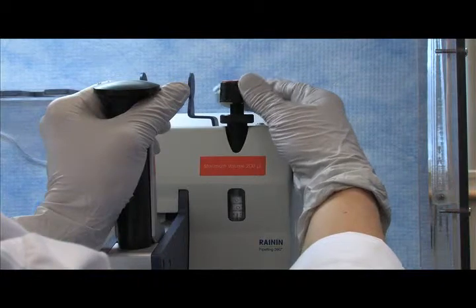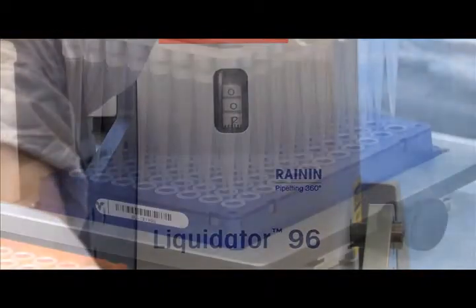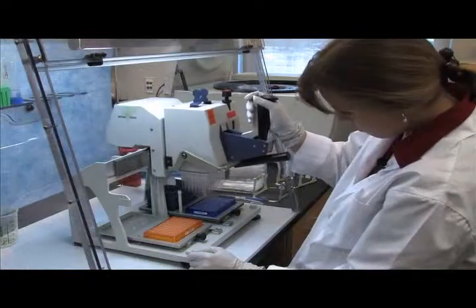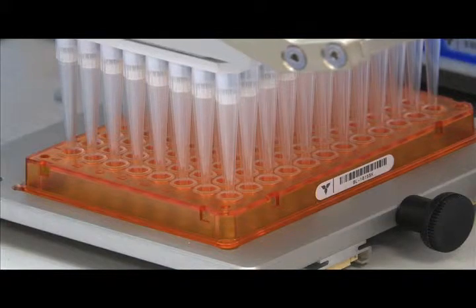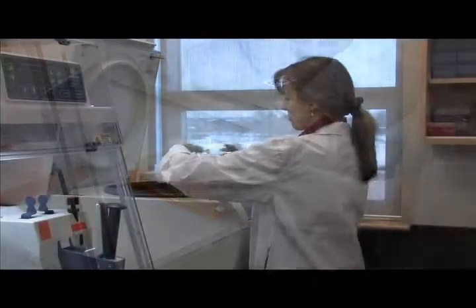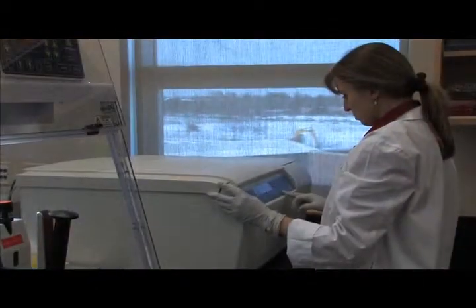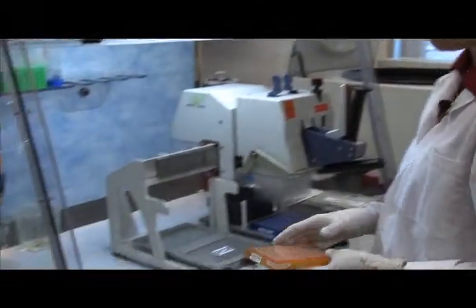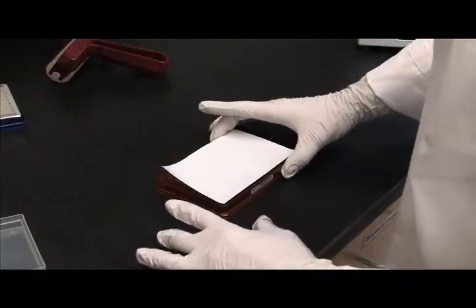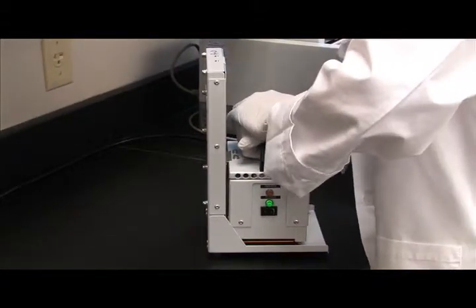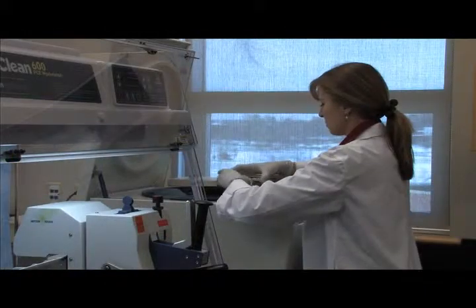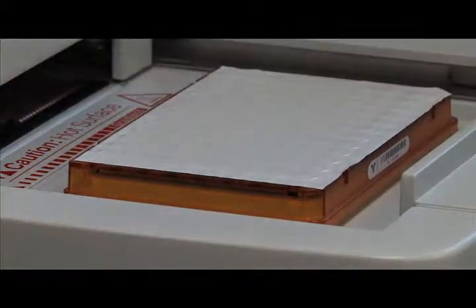In order to set up a PCR plate, 2 microliters of extracted DNA sample is added using Liquidator 96 to the pre-made PCR plate containing MasterMix. Plate is sealed and spun in the centrifuge. After centrifugation, PCR plate is further sealed using heat sealer to prevent any evaporation during PCR run. The plate is spun again at 1,000 g's for one minute and placed in the thermocycler for DNA amplification. This concludes the PCR step.